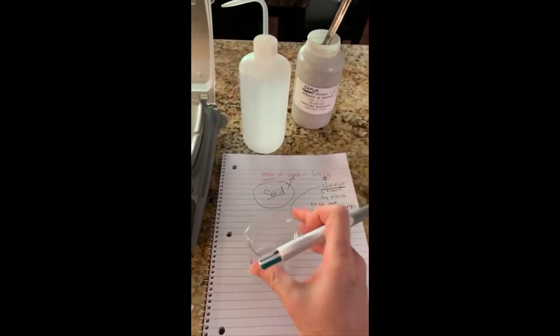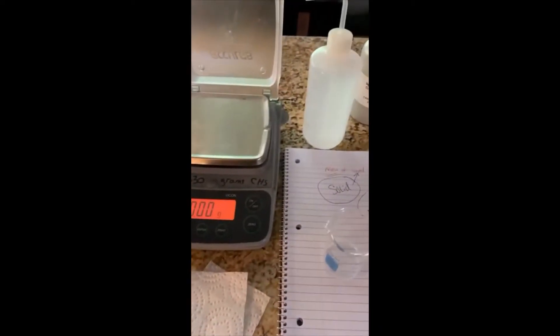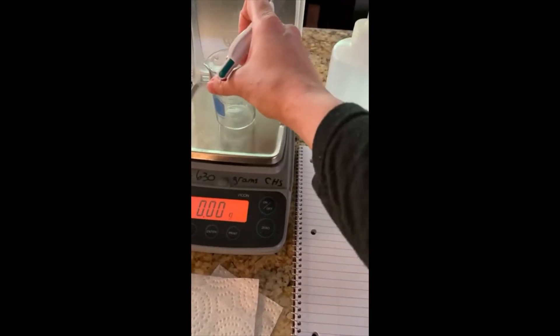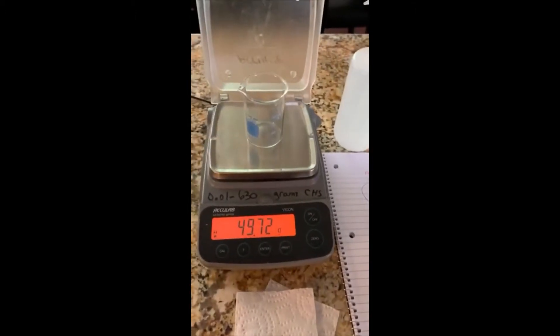With liquid, we can't just get out a weighing paper, put it on, and then put the liquid on there. It doesn't work. So here's where we have to do a different method.